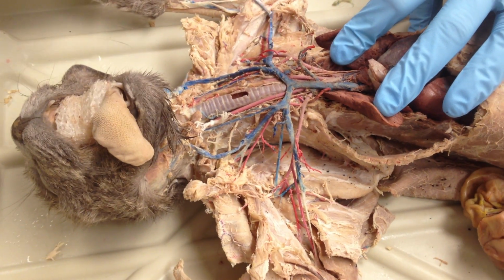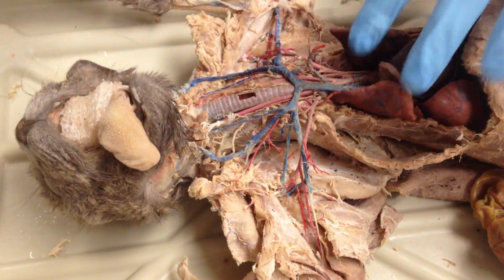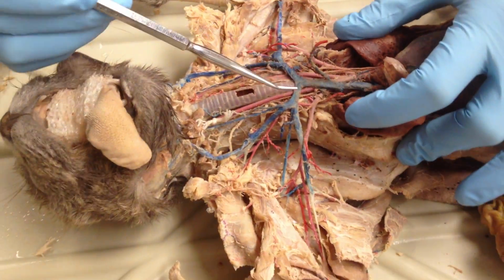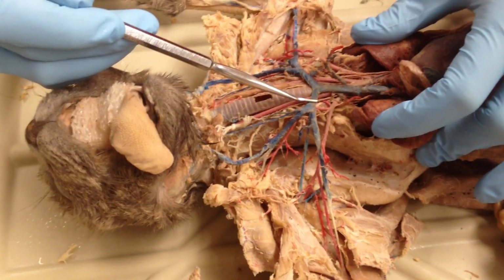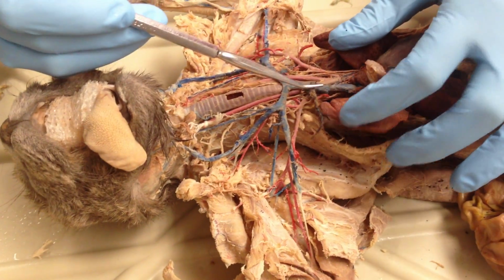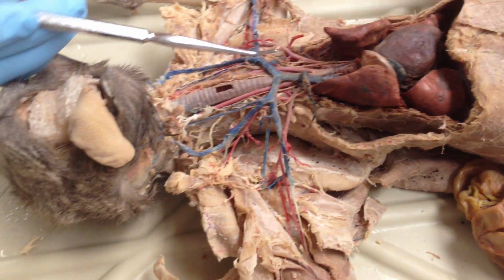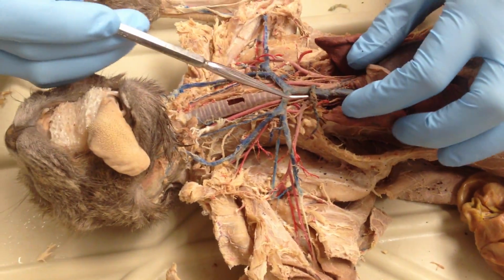superior. I'm like, not anterior. Thank you. Superior vena cava. You sure you guys want me to do this? Yeah. I'm just kidding. I'm a little scared right now. What? It could be anterior. Yeah, that's called the superior portion. I mean, compared to the posterior. Let's not make this complicating.